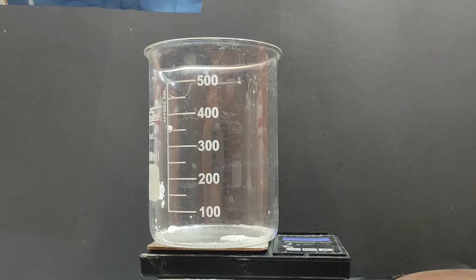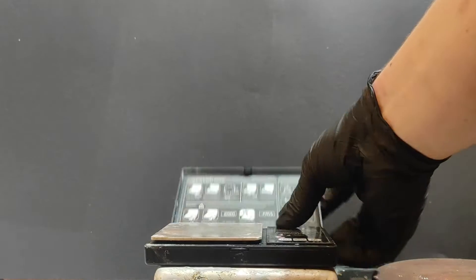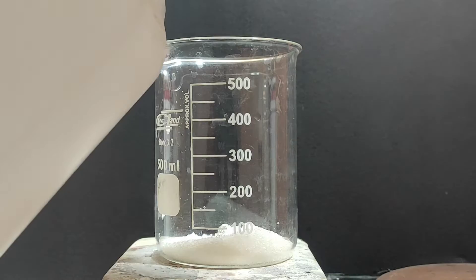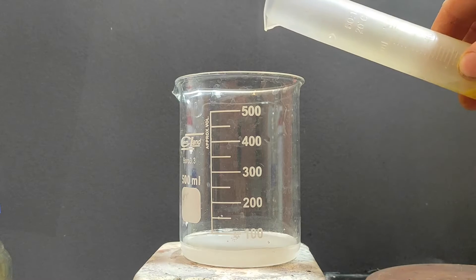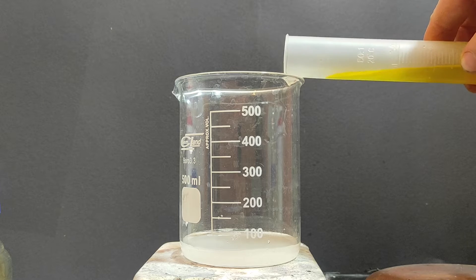When recording this video I didn't have the oxalic acid on hand so I've just decided to make some. First, to a beaker I've added 25 grams of sugar. I've put my scale aside and I've added 50 ml of distilled water and finally to top it off 12 ml of red fuming nitric acid.